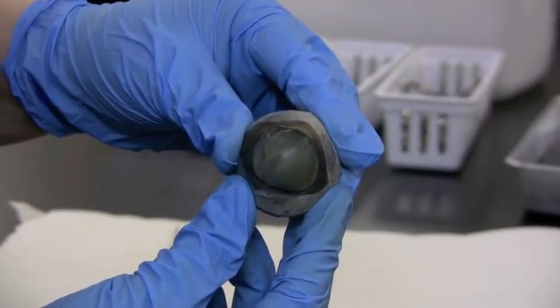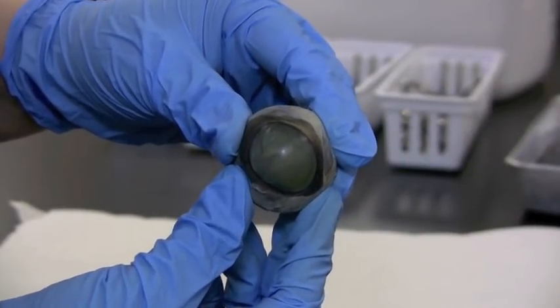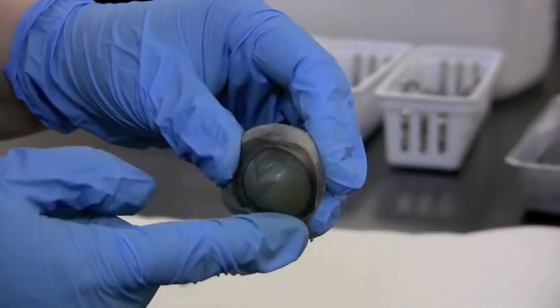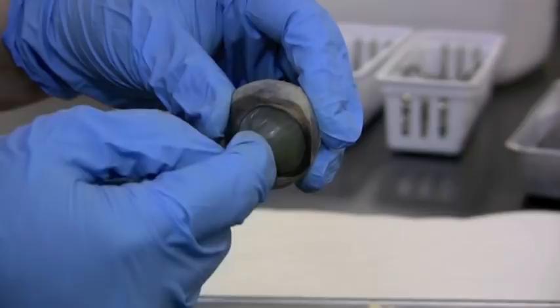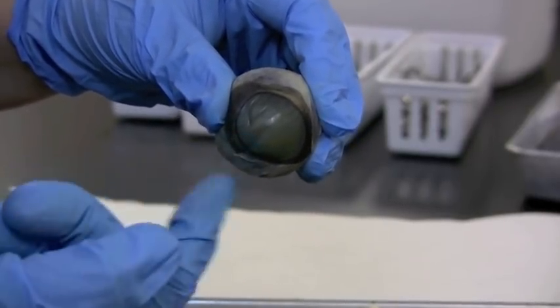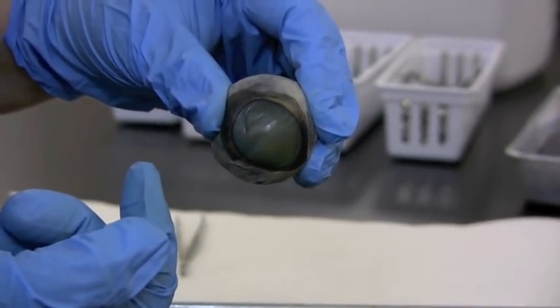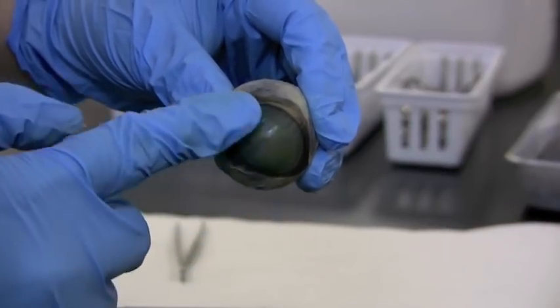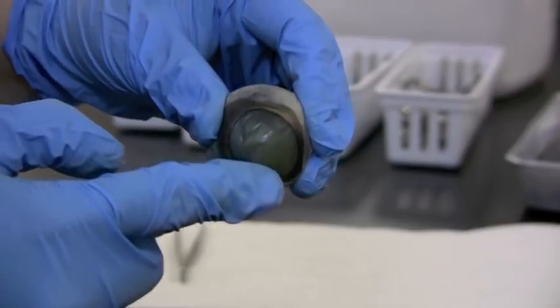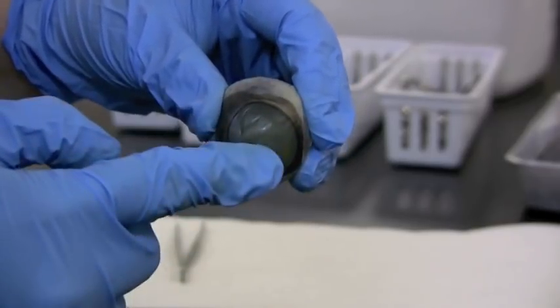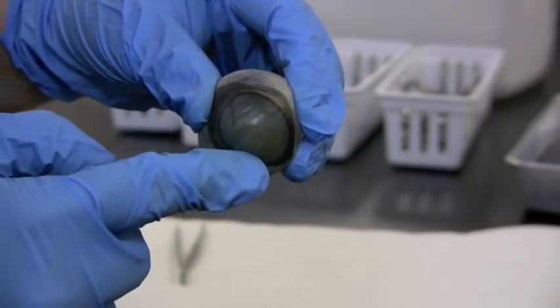So here we have the eyeball like it would be looking at you, but the cornea is very cloudy. So you can't see through it like you would when this was in life. The clouding is just a change, denaturation of the proteins that are in here. The cornea has to remain pretty clear. So this isn't really what it looks like normally.